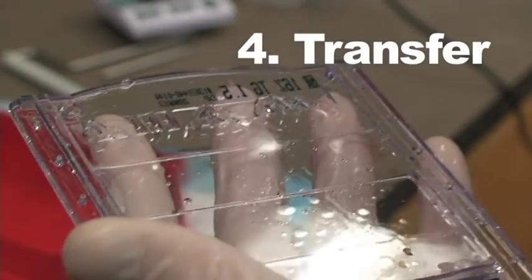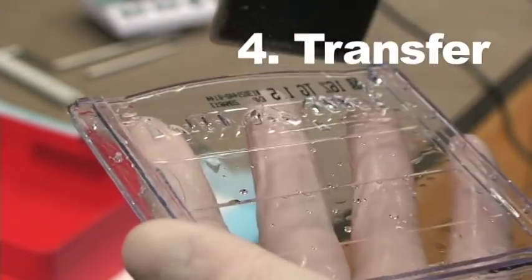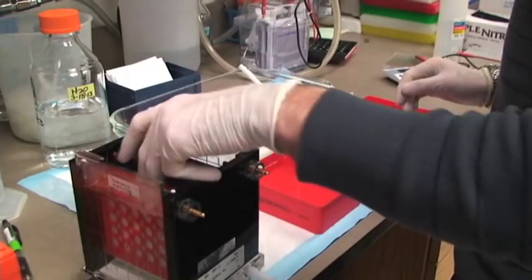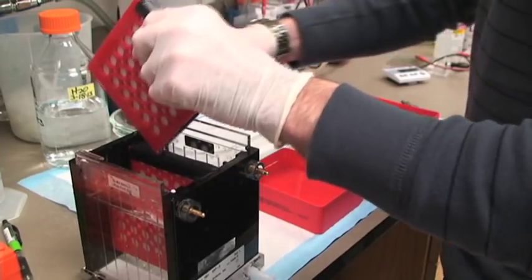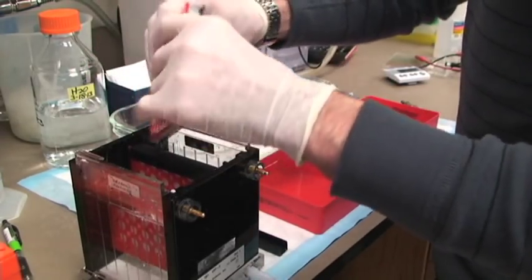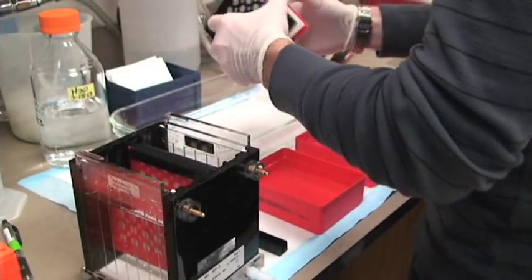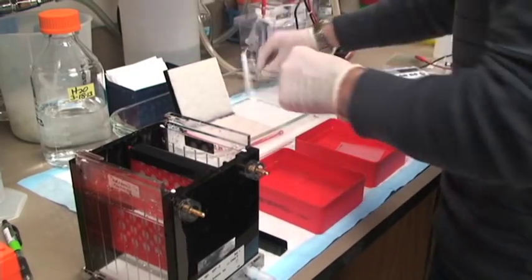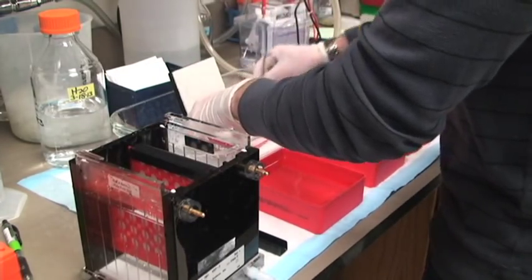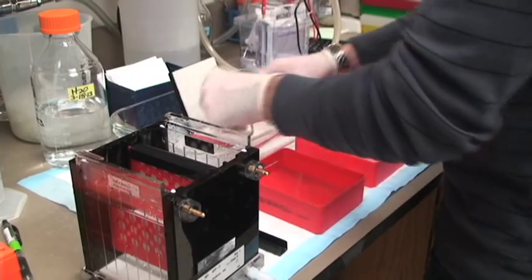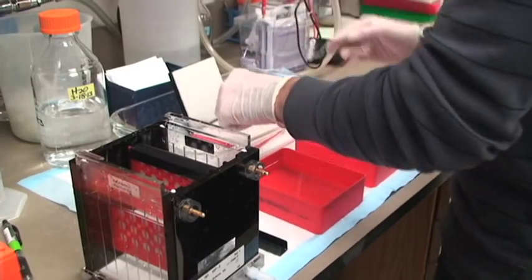Now that the proteins have all been separated in this gel by size, Larry's chopping off the top of the gel, which doesn't contain any proteins, and he's going to set up his transfer sandwich. In this step, we transfer everything that's on the gel onto a nitrocellulose membrane, and that's because the gel is really fragile, and the proteins in the gel aren't accessible to antibodies.